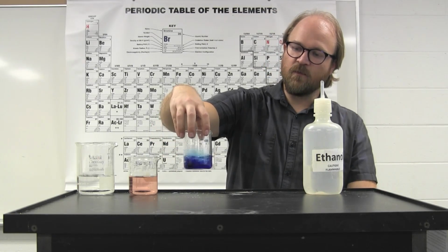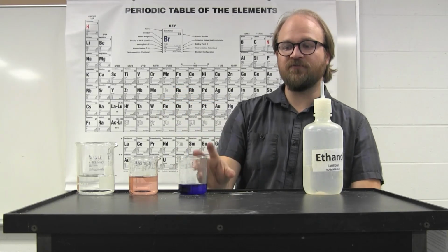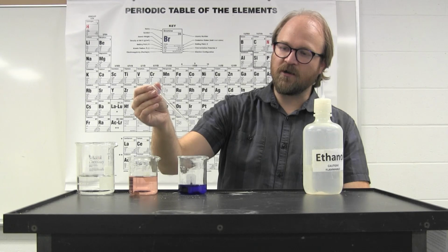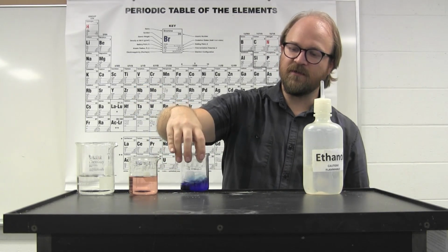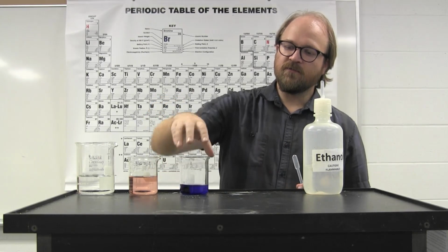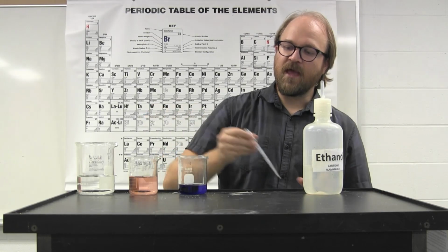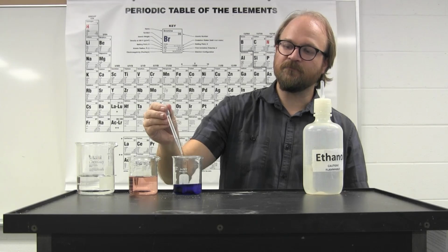By starting with the blue solution of the cobalt tetrachloride complex and adding a very small but known amount of water, the color of the overall solution is a blend. The solution color is a mixture of the blue cobalt tetrachloride and the red cobalt hexaquo color.